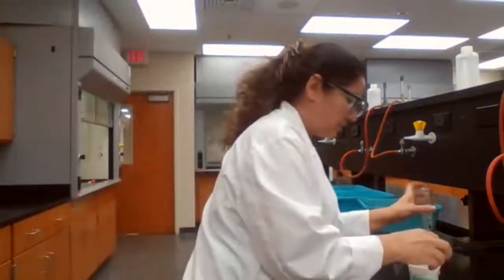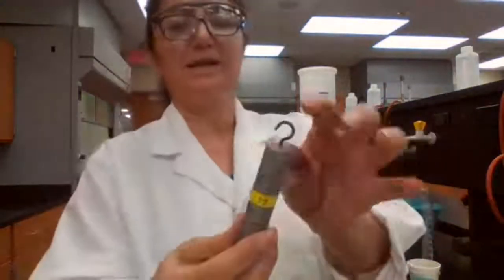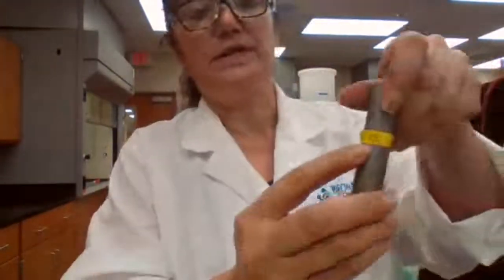To measure the density for solid, first we are going to measure the mass. It's irregular shape, so we cannot measure the dimensions. We're going to measure the mass. So solid number is 13. It's just showing what number we are using, 13. Mass of solid equals 69.869 grams.